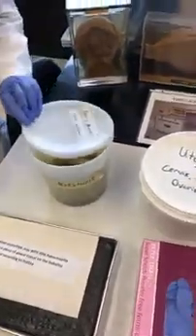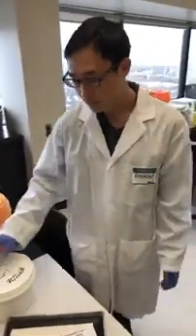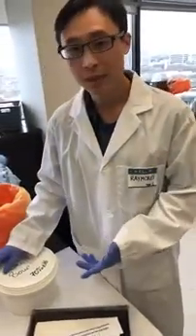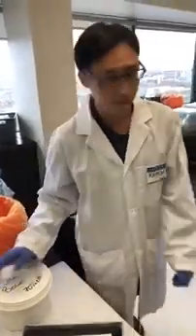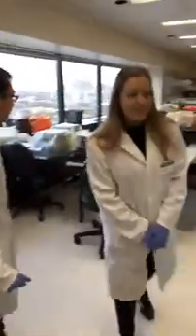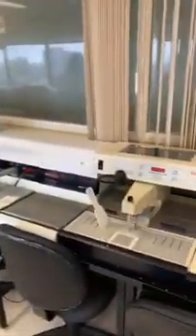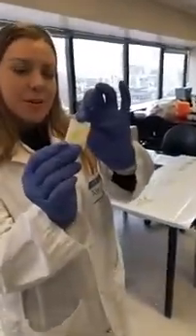What happens is that we get these samples from the hospital and break them down to look at the cells microscopically. To do that, we cut the samples up into small pieces and then embed them in wax. We usually use these machines and some wax — we put the tissue into a cassette and then let it freeze so it ends up in a block similar to this.